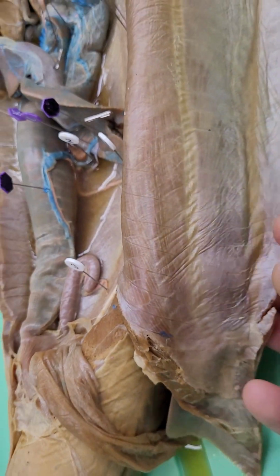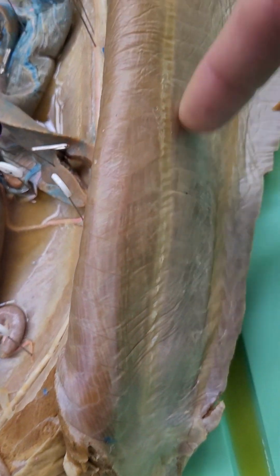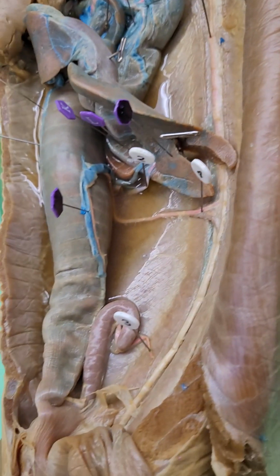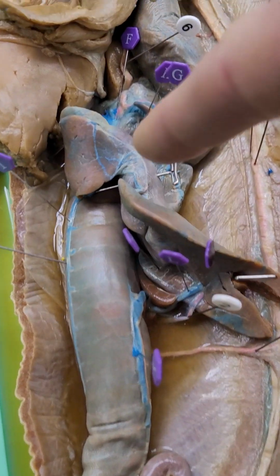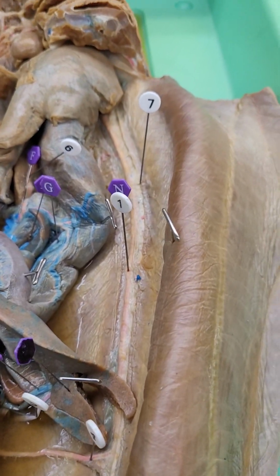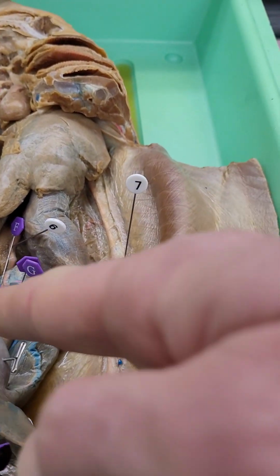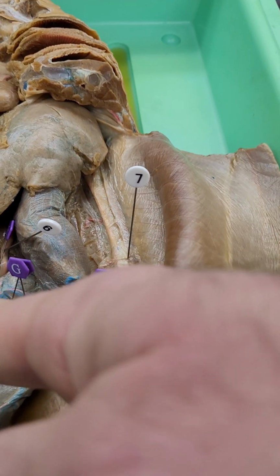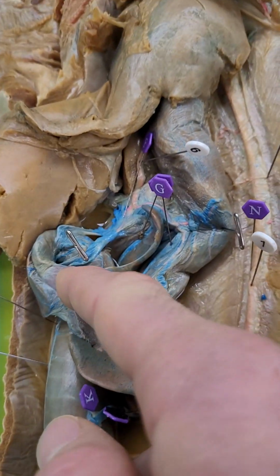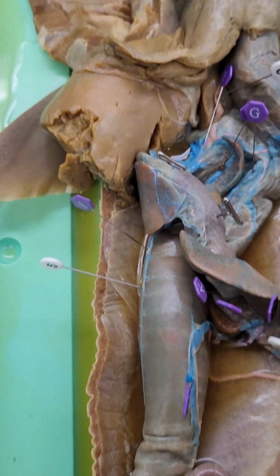We also have significant blood flow back through some lateral abdominal veins, which you can't see here clearly, but normally it's a very clear blue line on the side there. And then we additionally have blood flow going back through the hepatic portal vein, which should be here nice and clearly, but this is not the best or clearest dogfish. So it's going to be a yellow vein typically found just here. So that's probably going to be F just there. Okay, so that's how blood gets back to the heart.